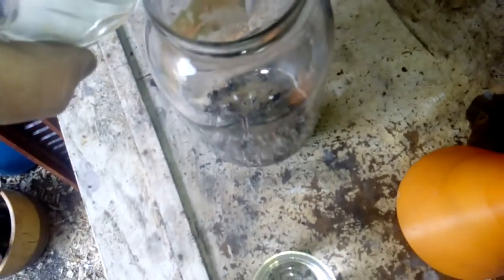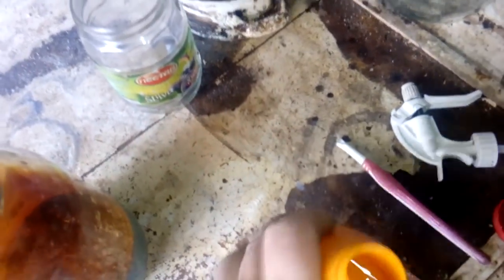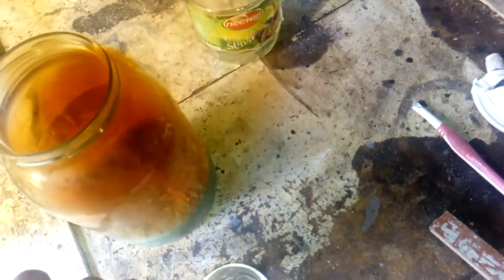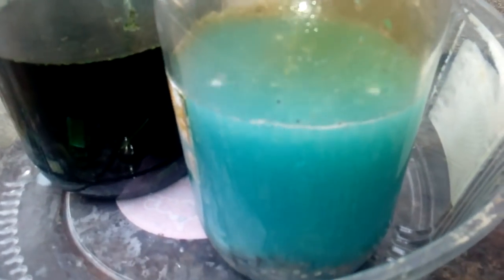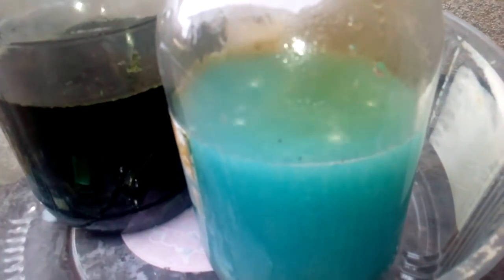First I will add 200 ml of nitric acid. The reaction already starts, then we add some water. Be careful of the fumes and put that on a catch pan. I put my mask on — never do this without a mask or gloves. I add 200 ml nitric acid and 400 ml distilled water.